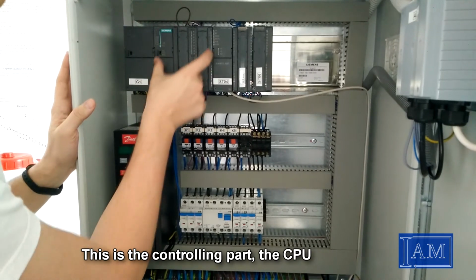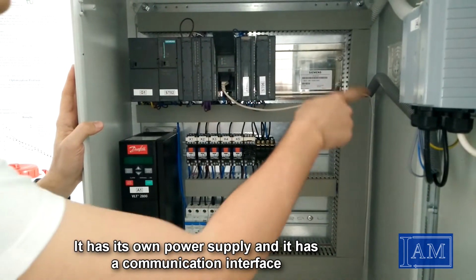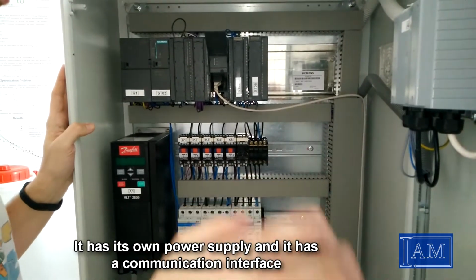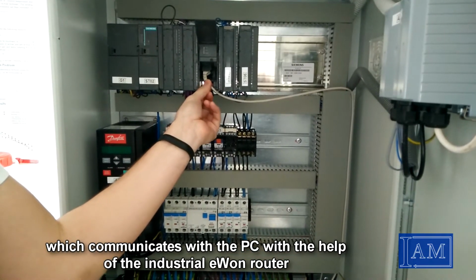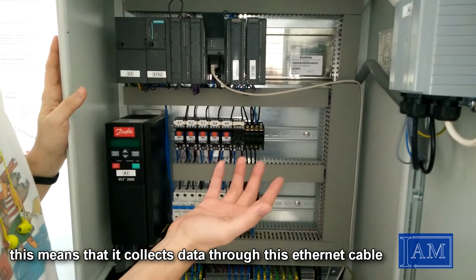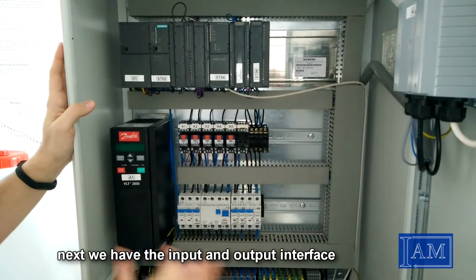This is the controlling part, the CPU or central processing unit. It has its own power supply and it has a communication interface which communicates with the PC with the help of the industrial router. This means that it collects data through this Ethernet cable.